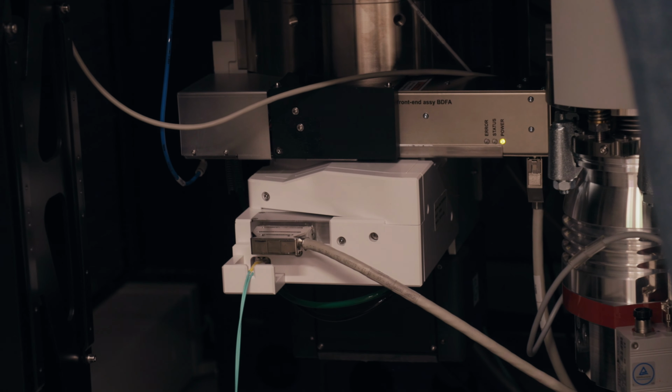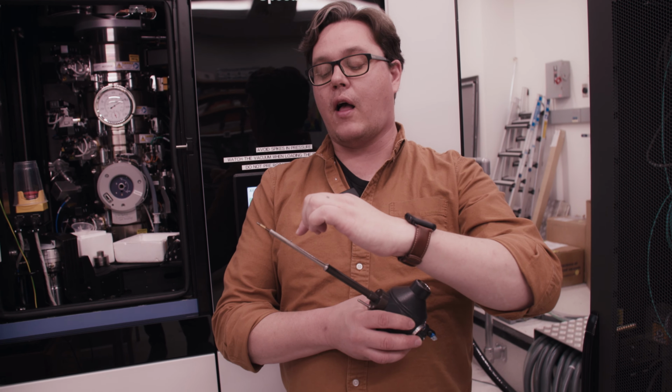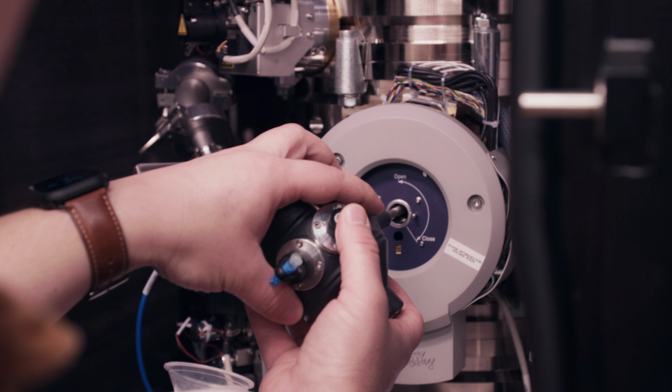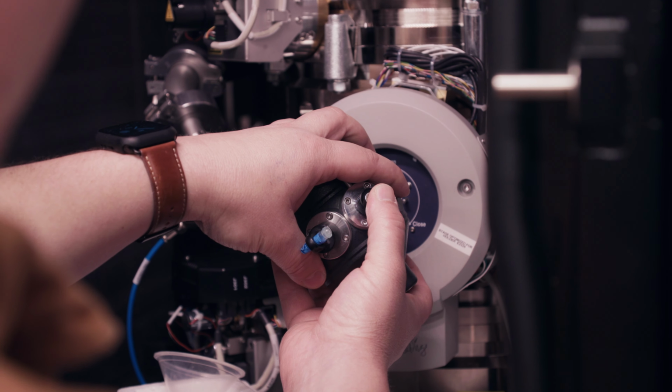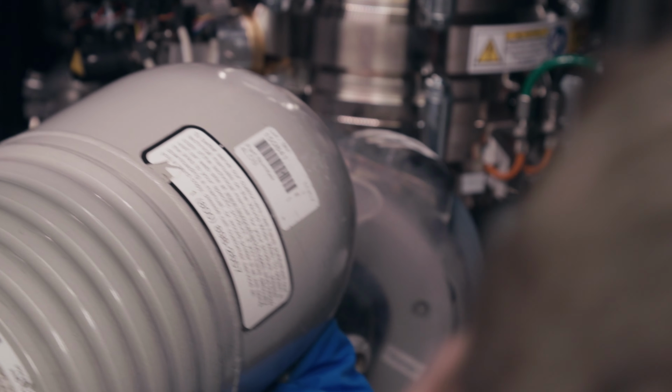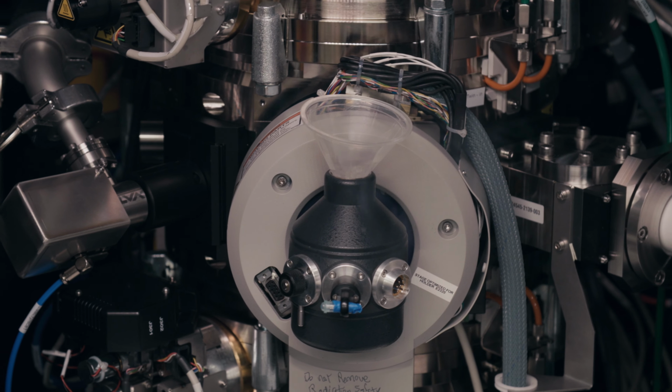The sample is inserted into the electron beam's path on a small rod keyed to move through an airlock into the high vacuum region in the center of the microscope. High vacuum is required for the electrons to travel from the source to the detector without being significantly scattered. The vacuum system, which uses roughly 10 different vacuum pumps, and the water cooling system required to keep the magnetic lenses from overheating, are significant complications in the electron microscope when compared to an optical microscope. All the machinery involved must be carefully linked together to inhibit disturbances in images at atomic resolution.